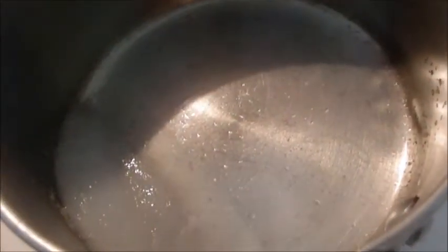Hey YouTube, I'm back after I chilled it. As you can see, you can see potassium nitrate — right there. Potassium nitrate. Awesome. Here I have some rags under a metal pan. It has an inside with corners and walls. I put rags in here, so I'll drain out the liquid and I'll have potassium nitrate. As you can see, you can see potassium nitrate right there. It's so beautiful. And that's potassium nitrate. I'm now going to put it on a different pan with cloth and let it dry.